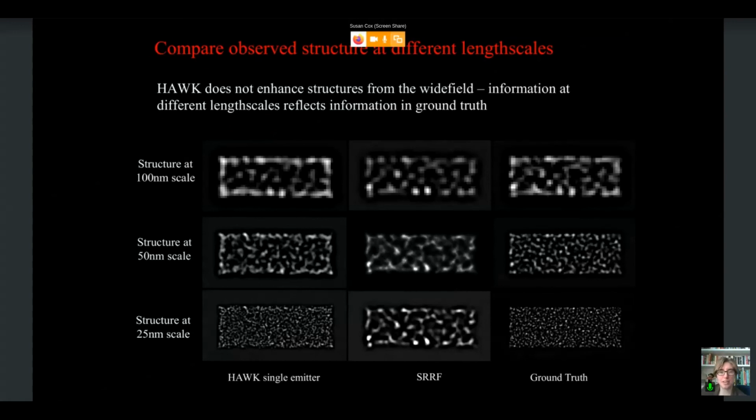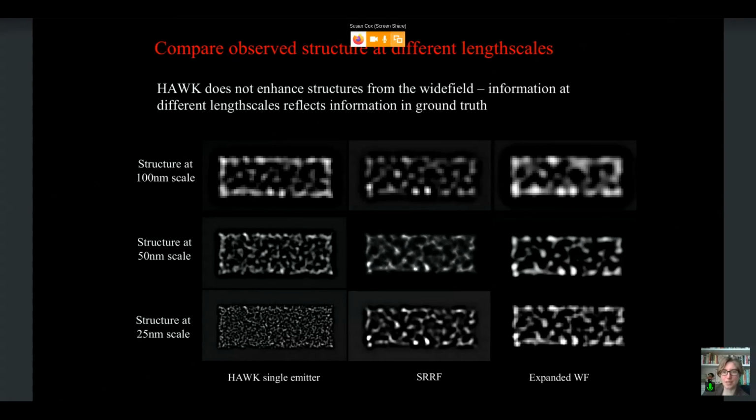And then we used a very high density data set, which we knew would give us artificial sharpening with one method, which I've just used SRRF here, but as I say, we could have used ThunderSTORM single emitter or anything else. And then we used HAWK single emitter, which we knew wouldn't give us artificial sharpening. And we then looked at the structure at 25 nanometers, 50 nanometers, and 100 nanometers. And broadly speaking, the HAWK single emitter appears to have more similar types of structure at those short length scales, which is what you'd expect because it should be most accurate.